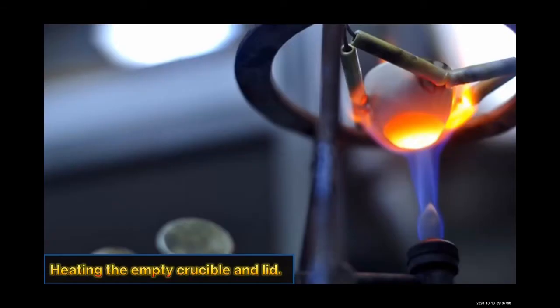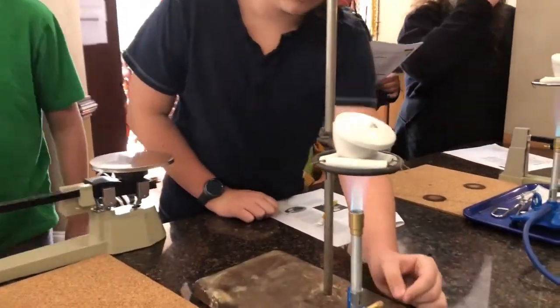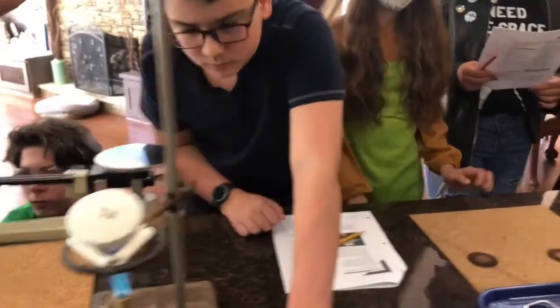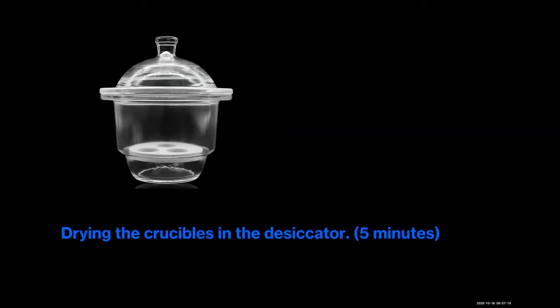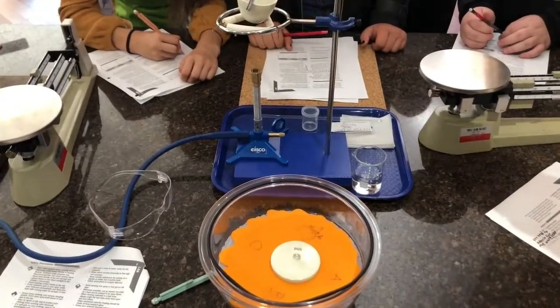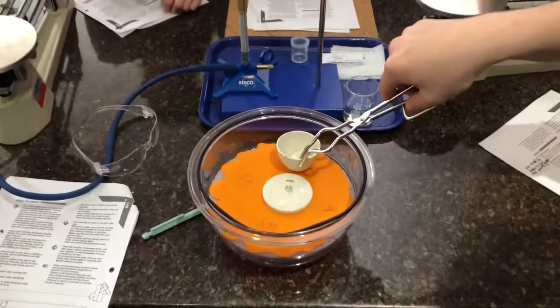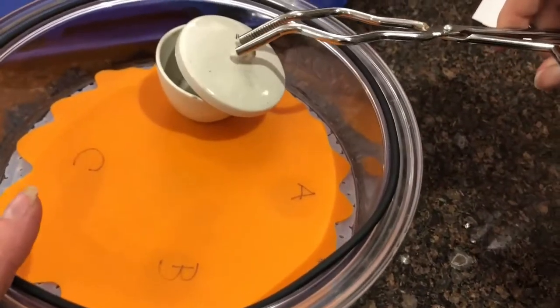Heating the empty crucible and lid. So you guys should be watching, and when it turns slightly red on the bottom, that's what we're looking for. It'll start to glow. Drying the crucibles in the desiccator. Put it tipped a little. Perfect.